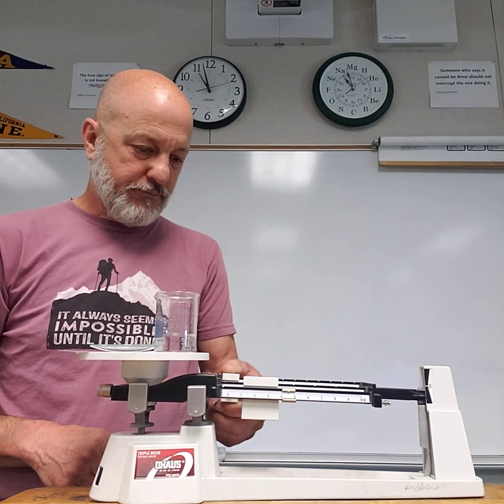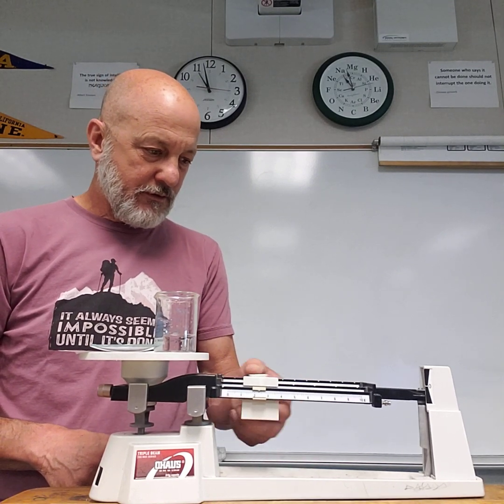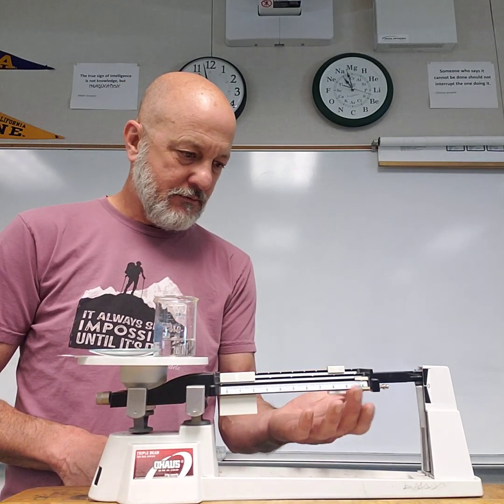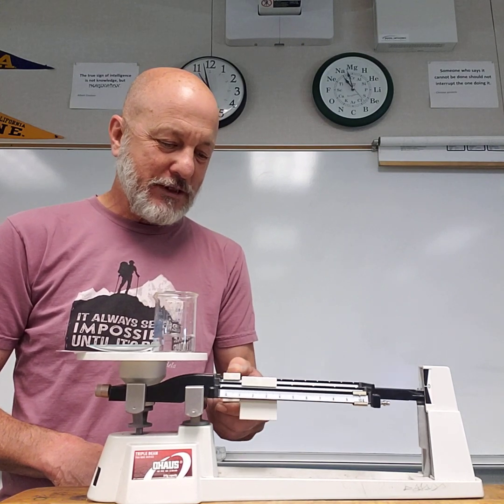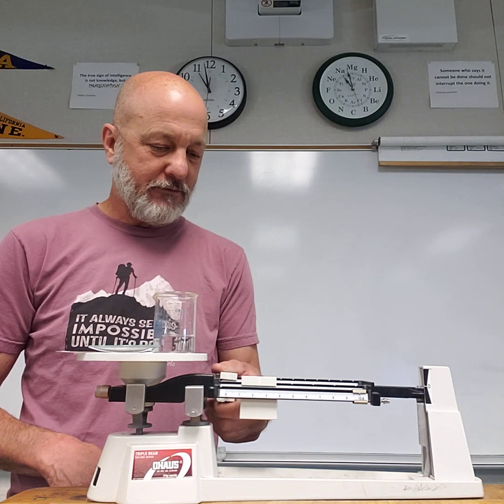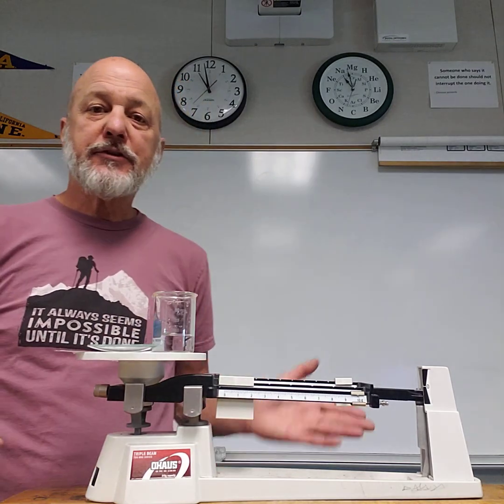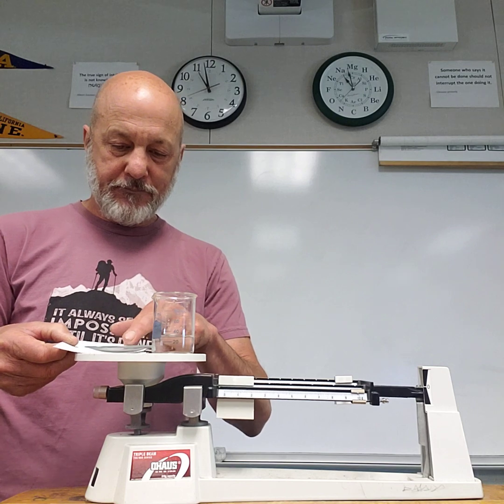Bring it out, be as precise as possible. We're kind of working on precision, maybe not. Okay, I'm not going to go through those steps on the video, but make sure you get your accurate mass. So get your accurate mass reading of this beginning point.